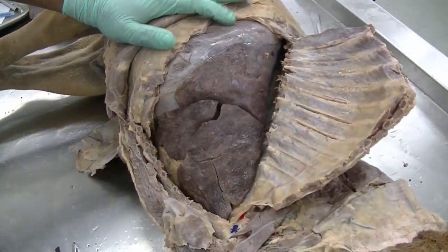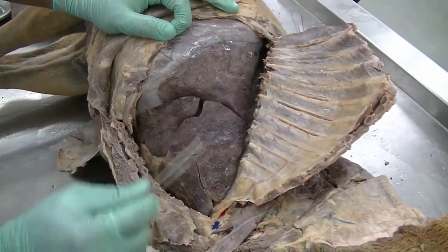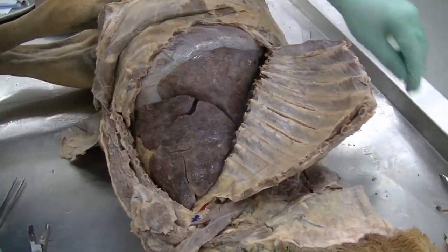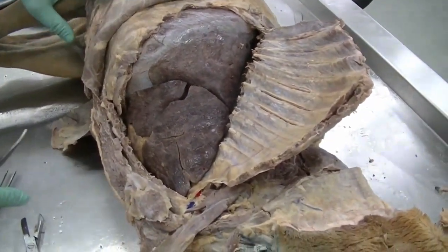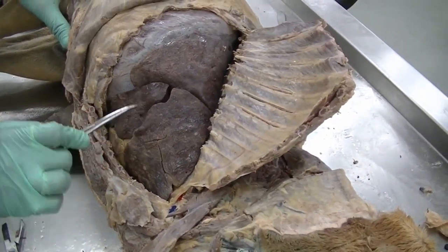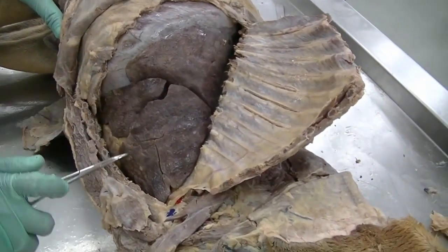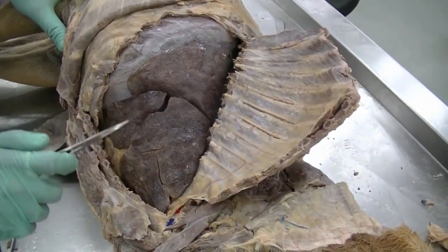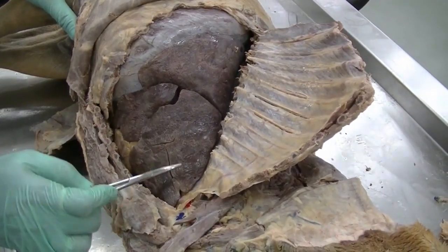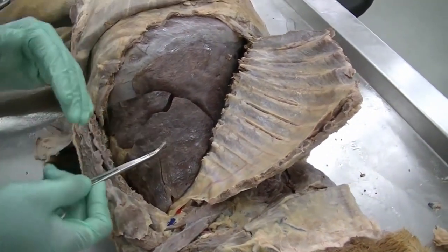The right lung of the dog is a little different than the left lung. The same apex as well as base of the lung is present, and we can see two oblique fissures which run through to divide the lung into three major lobes that are visible from this side. There is one more that is not visible as yet. So we have the cranial lobe, the middle lobe, and the caudal lobe of the lung. But we'll include that description a little later.